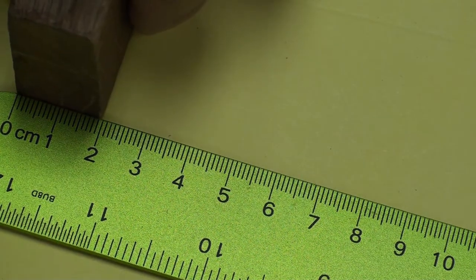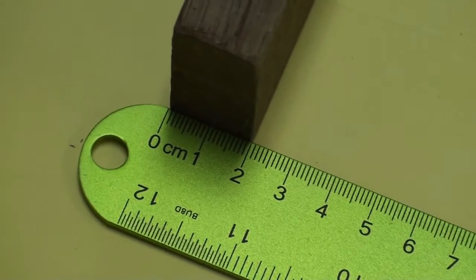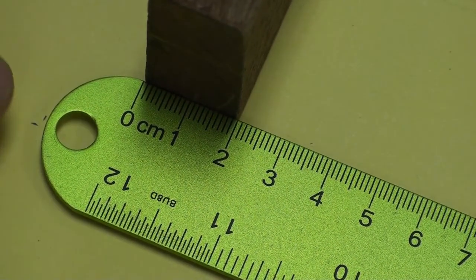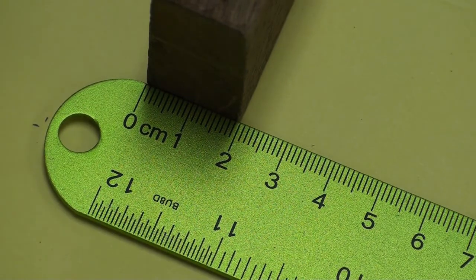Next thing we're going to do is go to the height of block M. This one doesn't like to zoom in too far, does it? And I think that's about right. Height of block M.